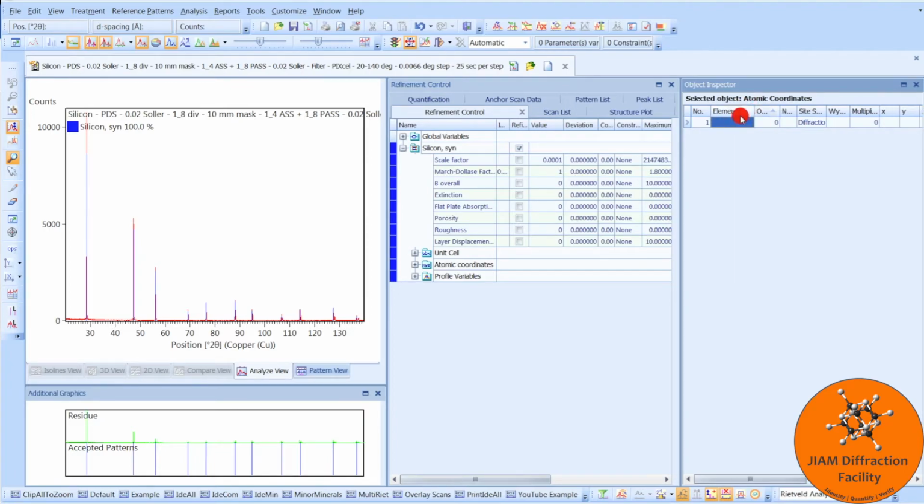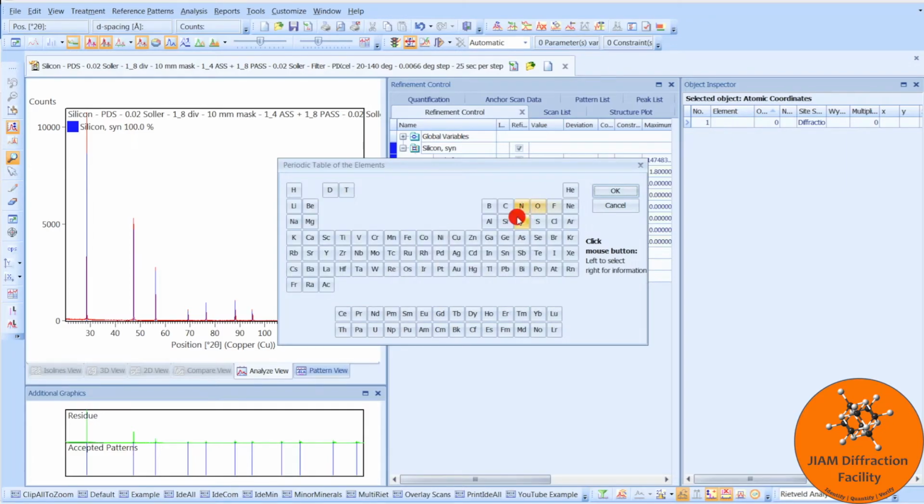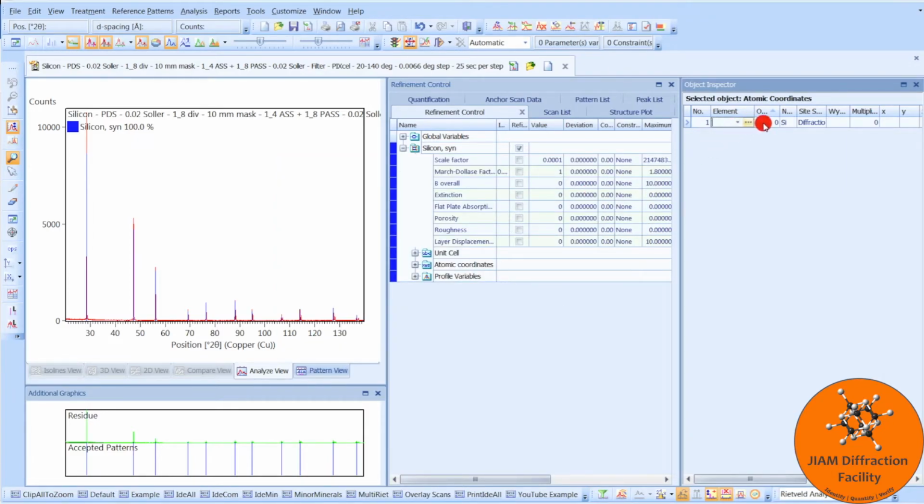Here we have what element we are choosing. So for this example, it is silicon. Next we have oxidation. For this example, it's 0. Here is the name that should automatically fill in when you choose your element. Scroll over here. Wyckoff, that is something that you would get from, say, a journal article. I know for this example, it is 8a. When I enter this, it should change the multiplicity and then the X, Y, and Z atomic coordinates to match whatever 8a corresponds to.